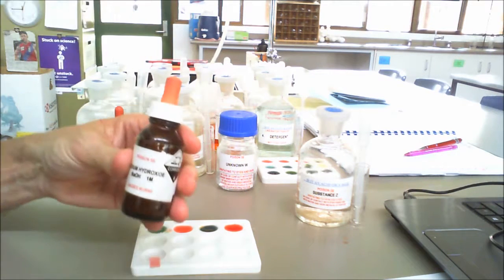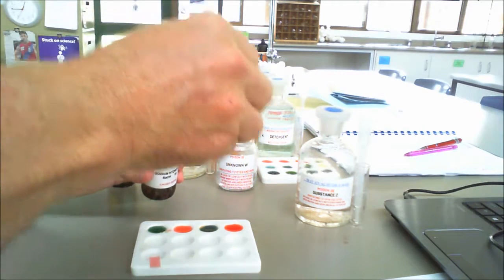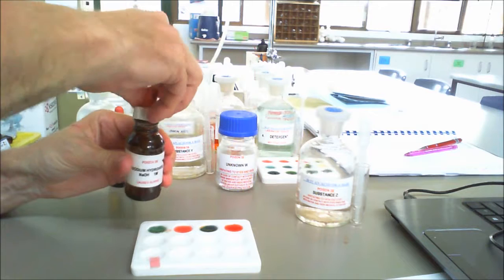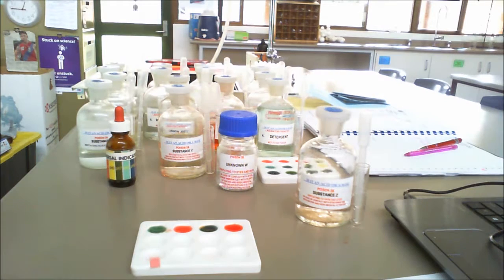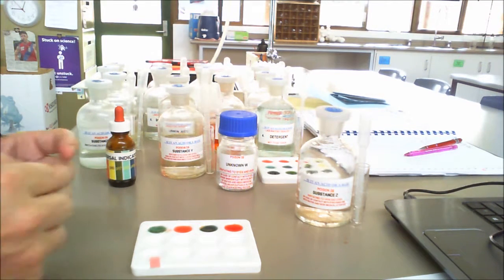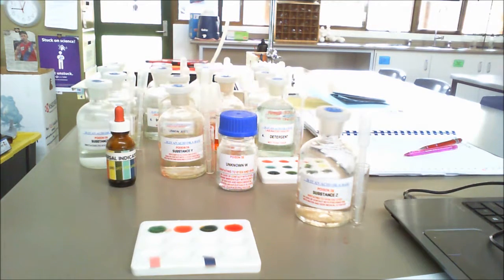Now let's put some sodium hydroxide here. This is a caustic soda, or stuff that you use to clean your oven with. So we put a couple of drops there, and for this one we use red litmus paper, and if that red litmus paper turns bluish, then that tells us that it is a base. So let's see if we can grab a nice red piece. And as you can see there, it's turning blue. So that tells us it's gone from red to blue, so that tells us that it is a base.